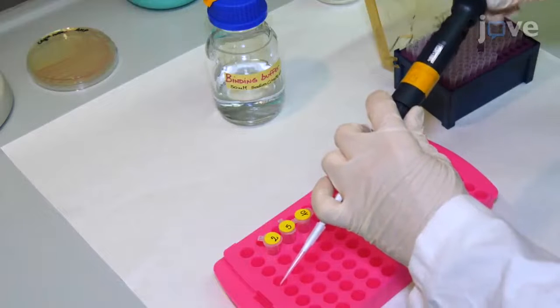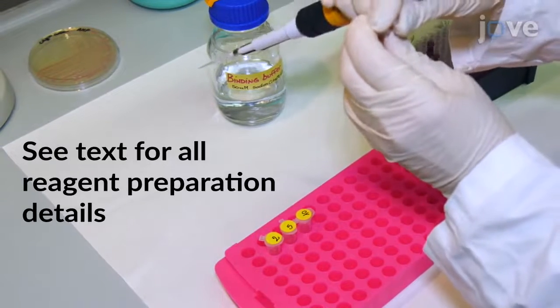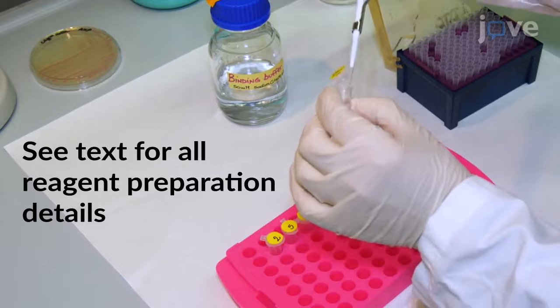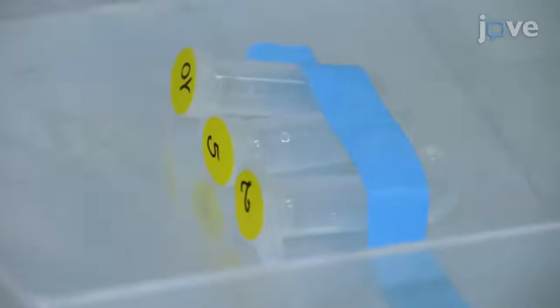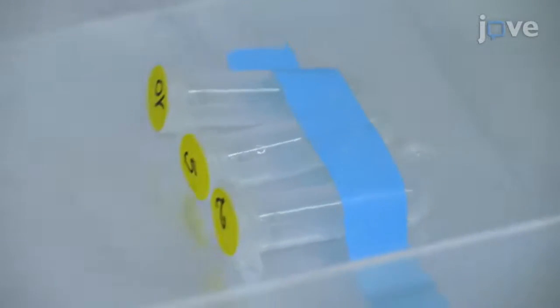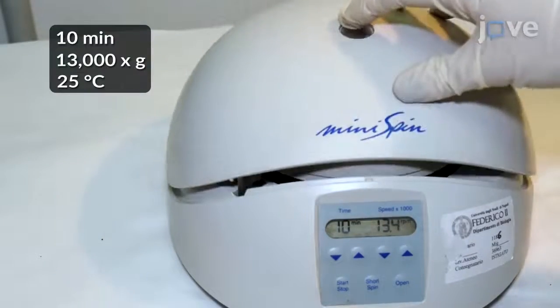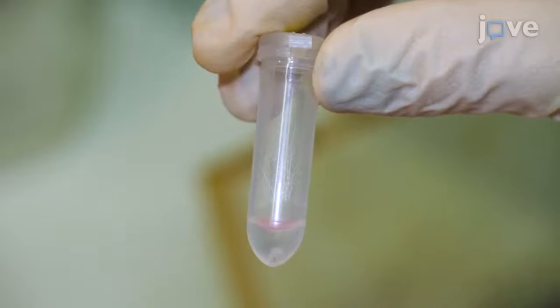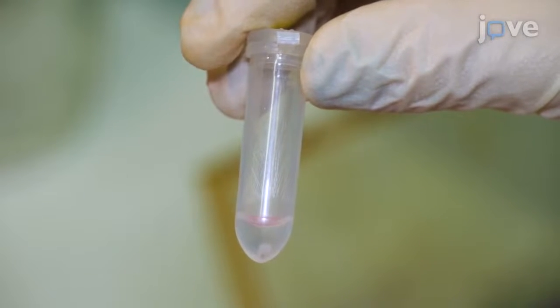Begin by labeling 2 × 10⁹ B. subtilis wild-type purified spores with 2, 5, or 10 microgram concentrations of model RFP in 200 microliters of binding buffer supplemented with 50 millimolar sodium citrate for 1 hour at 25 degrees Celsius on a rocking shaker. At the end of the incubation, pellet the binding mixtures by centrifugation and transfer the supernatants into new conical tubes for subsequent adsorption efficiency analysis.